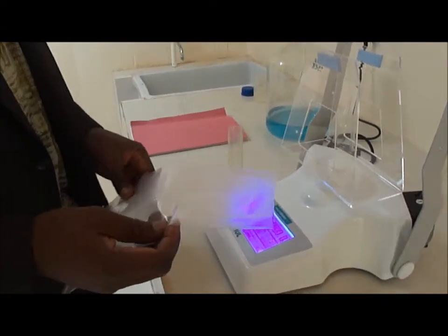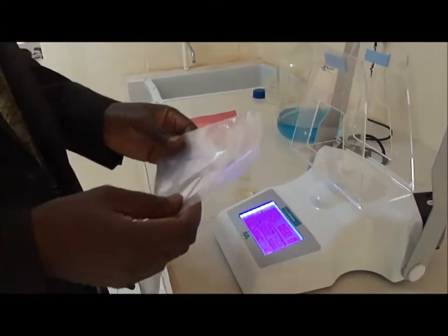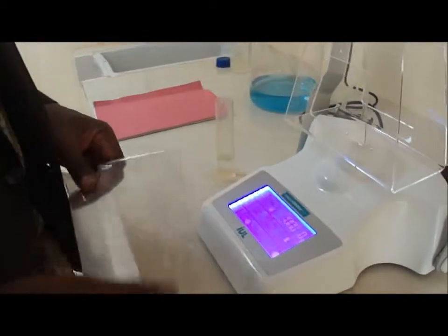Now I will explain the dispensing process. Again, we have the starting screen.